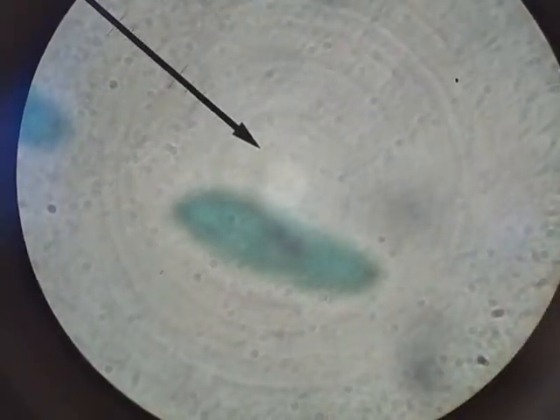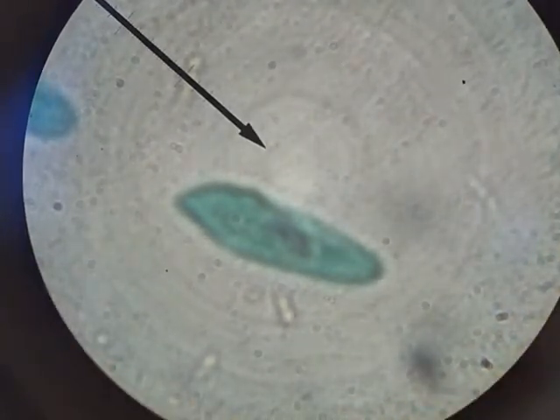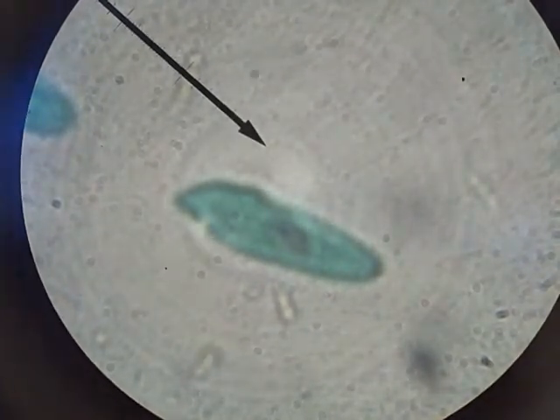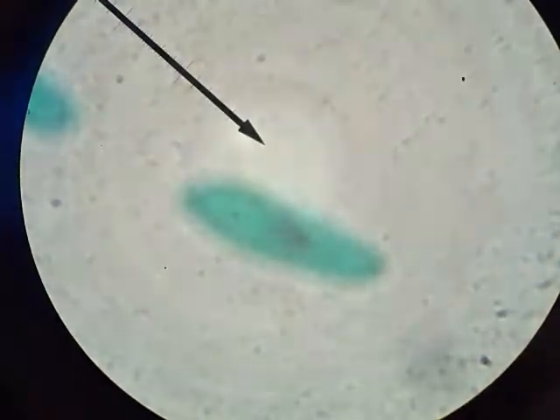We'll go up another magnification now. Notice we have our one object right in the middle, and the ones that were at the left of the screen are now gone, because when you go up on your magnification, you have a smaller field of view. We want to bring this little fella in focus by using the fine adjustment only. I'm turning that now to try to bring this object in focus. Be patient with it, moving it back and forth until it looks the best to you. Notice also, as we've been going up, our image is a little darker. One thing you want to do so you can see your image better is to open up your iris diaphragm.